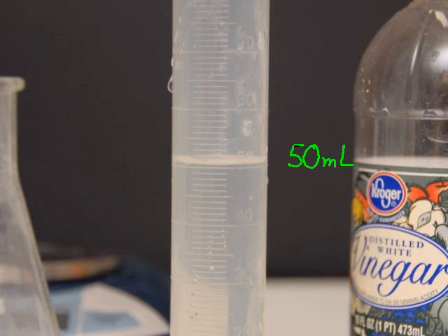And anytime you read a graduated cylinder, read it at eye level. Get your eye at the same level as the liquid level. And you can see here, that's where the liquid level is, right there. And I have a little bit more than 50, but that's okay. We're just using this vinegar to try to make carbon dioxide.